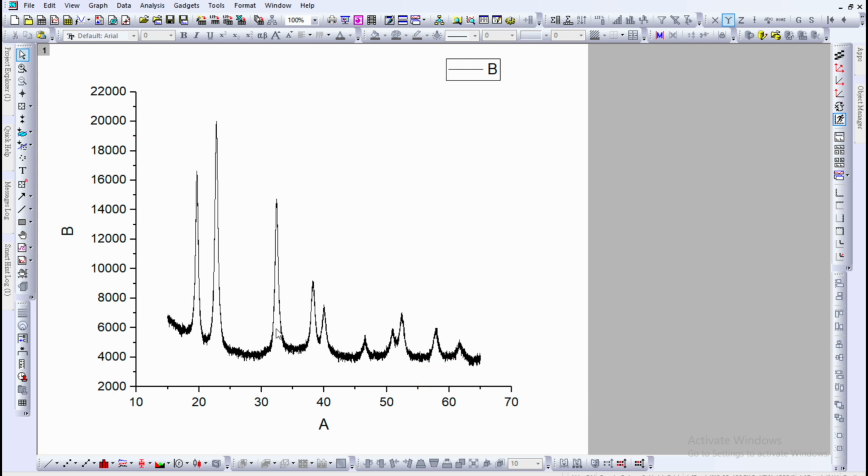This is the XRD data where the x-axis is two theta and y is the intensity. Here we can see the background looks noisy. So how to smooth that one?